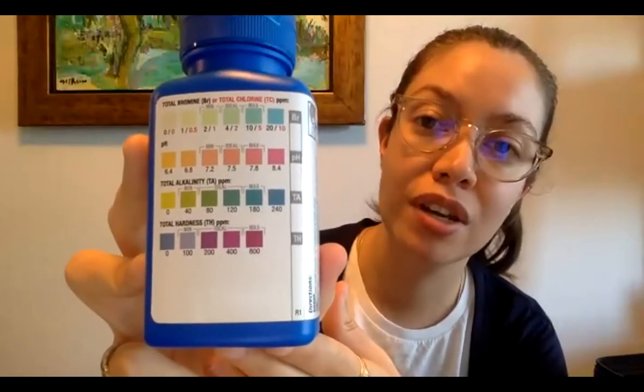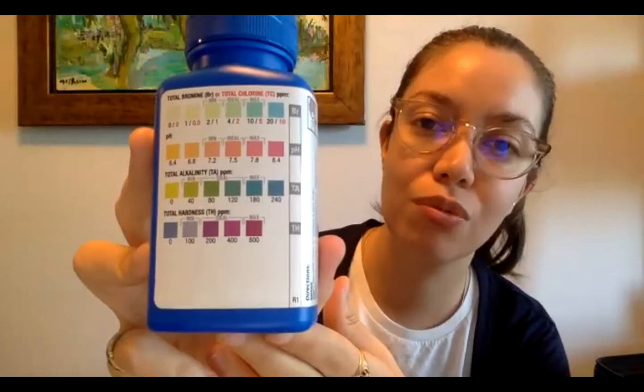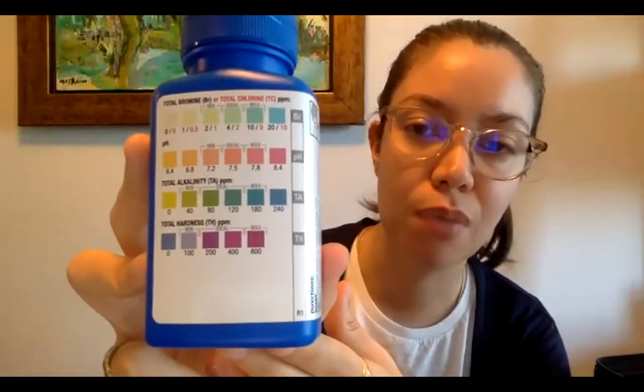The second thing is pH. A pH of 6 to 8 is quite normal for different water bodies. So when you test your water body a few times, you're going to see what the normal pH is, more or less. So that range should be pretty small. And then if there's ever any fluctuations, then you can start to wonder, oh, why are these fluctuations happening?